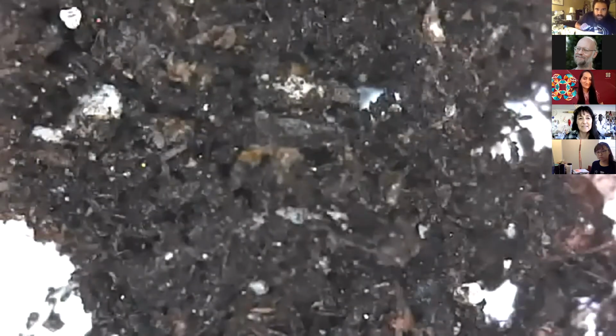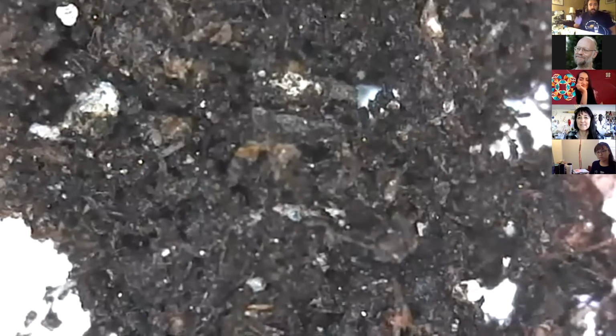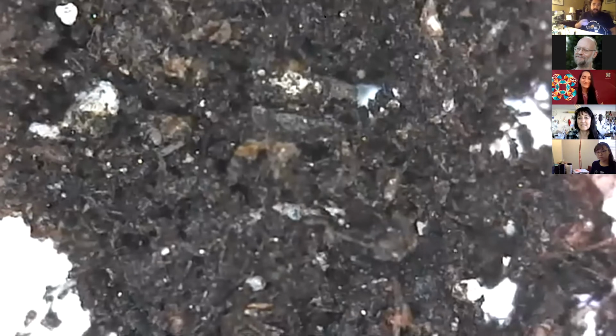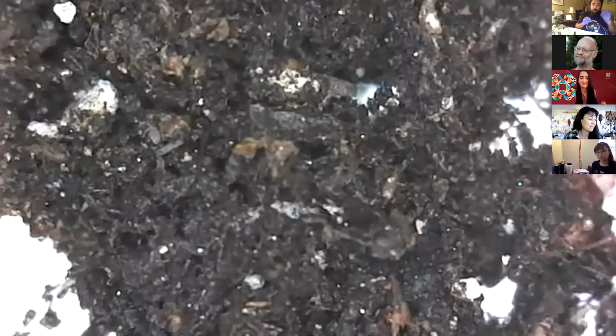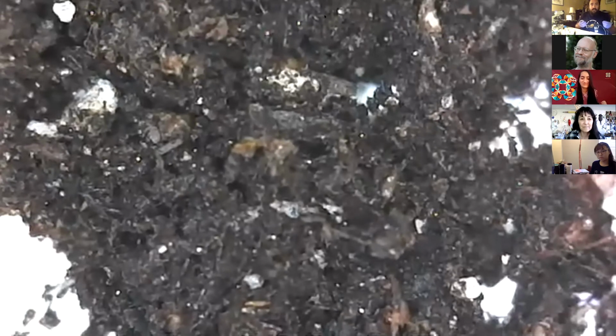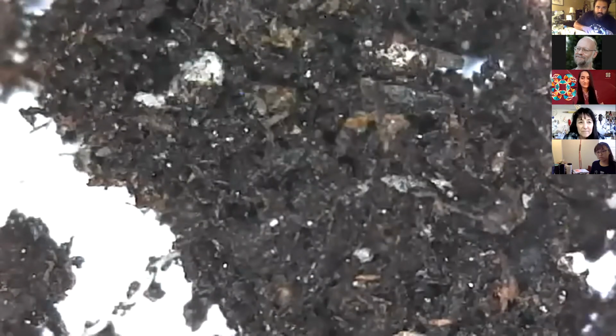All right, so we got some structure here. We see a composition of little bits of wood. Those are the little debris which fungi are actually living in and decomposing. Bacteria are going to be living on smaller chunks of that organic material, the humates, and then the mycorrhizae are going to be binding them all together. Also, we look at the color, it's a nice little 70% cocoa brown color. We do see some darker little bits in there.